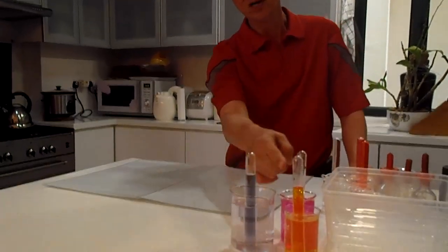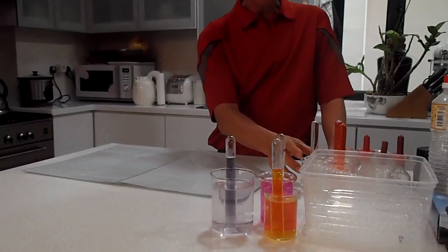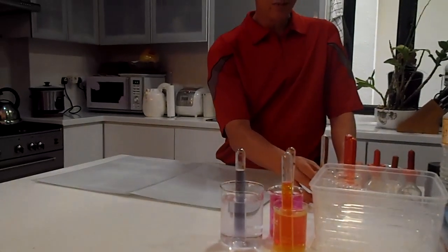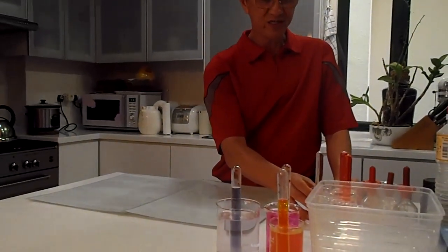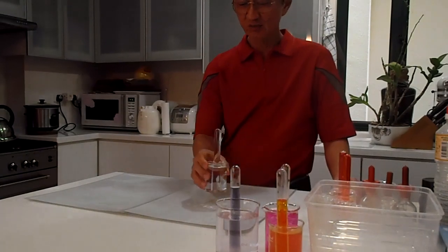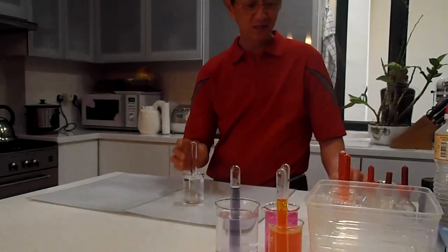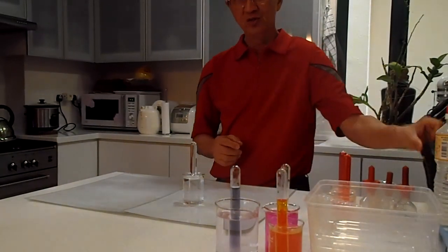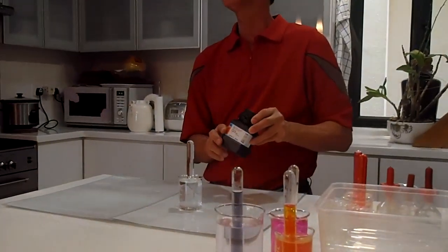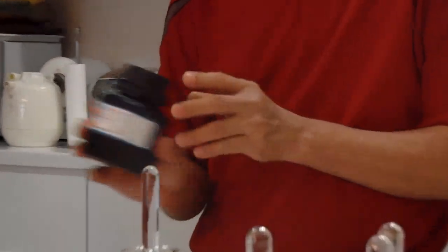You see that these are very colorful. Before you came, I have put in something in the test tube which I am not going to tell you what. So what we are going to do is we are going to put calcium granules inside. These are calcium granules.